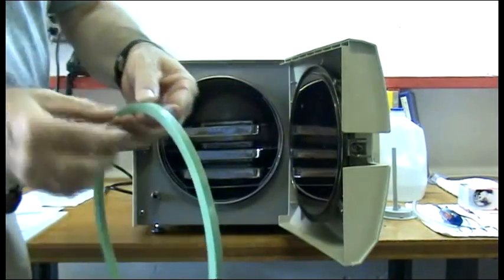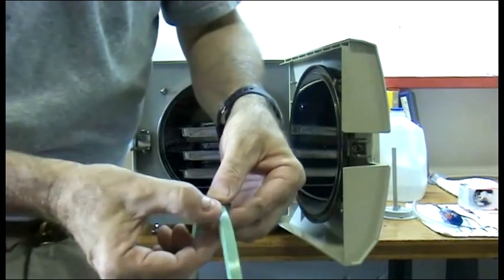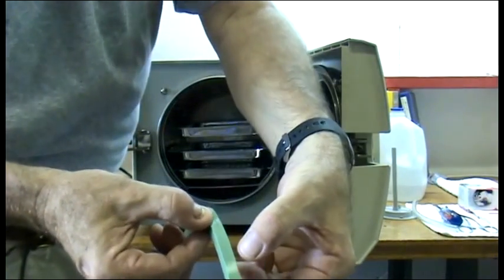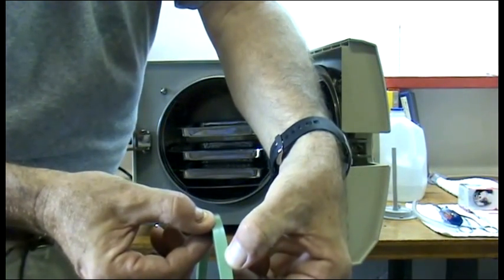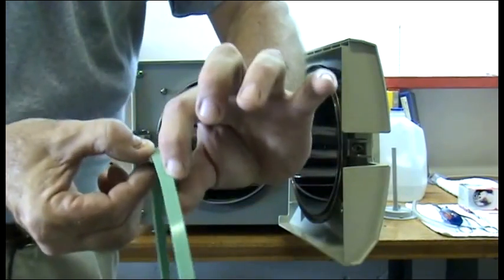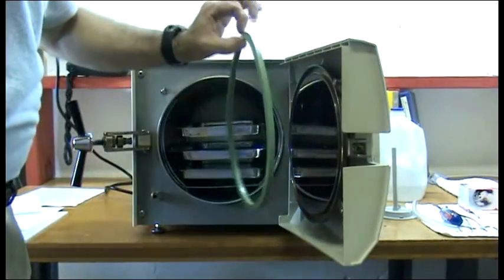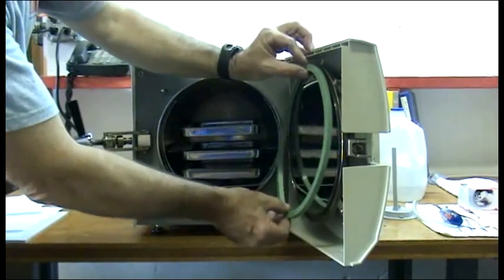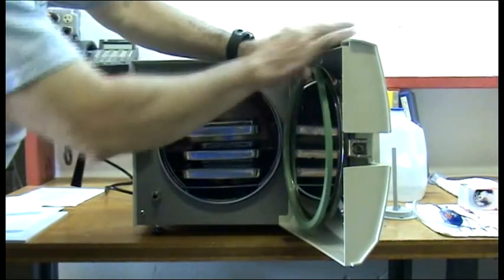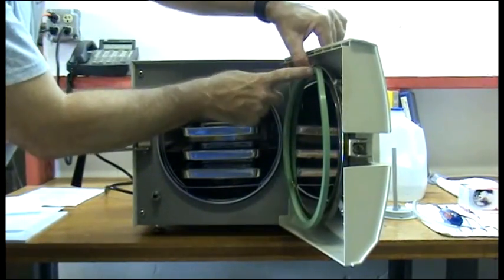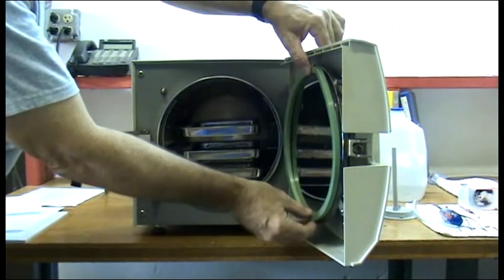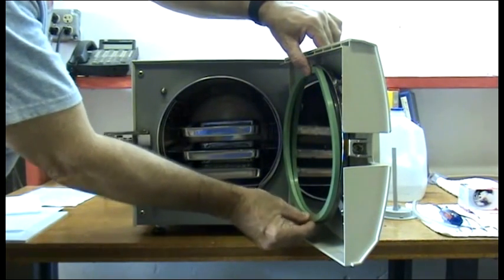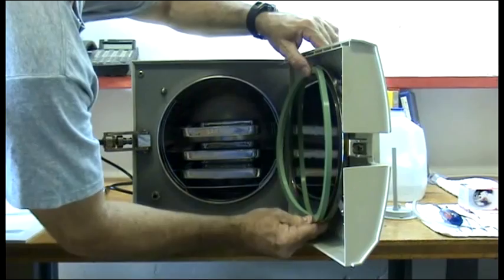You'll notice that the gasket has a trapezoidal shape. The dimensions are slightly different; the larger side goes to the outside. When replacing the gasket, your new gasket should be pressed in at the twelve o'clock position. Let it hang naturally, even out both sides, and press in at the six o'clock position.